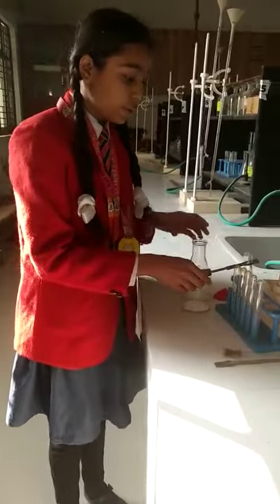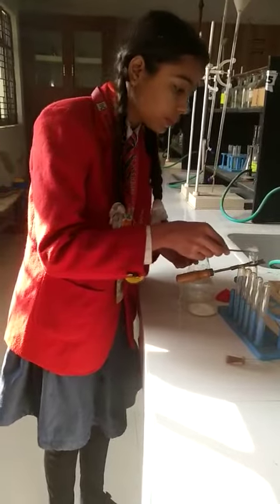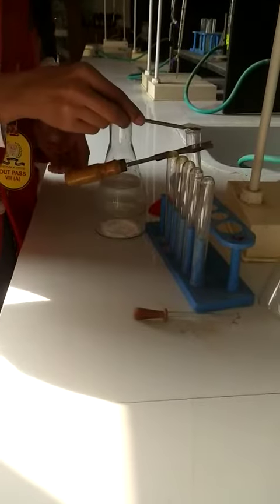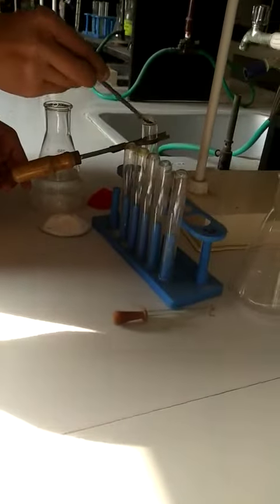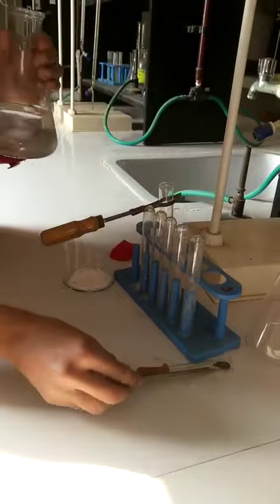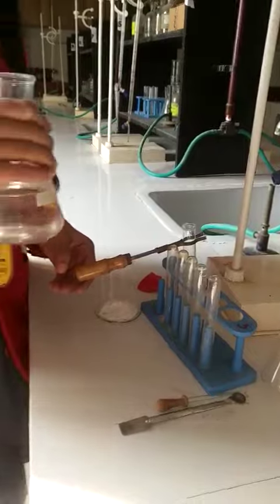So, firstly we are going to take some baking soda in a test tube. Now, I am going to add some vinegar in it so that I can easily show you that the reaction.